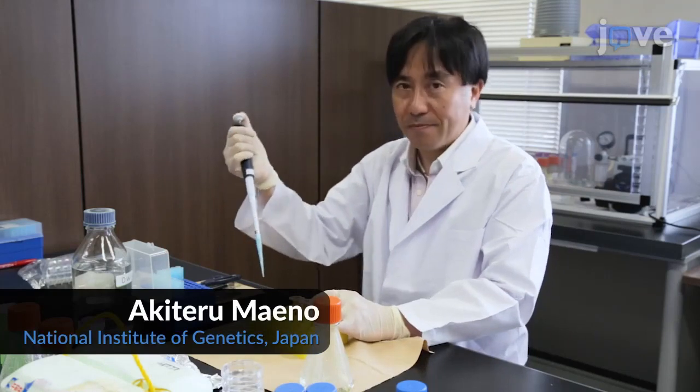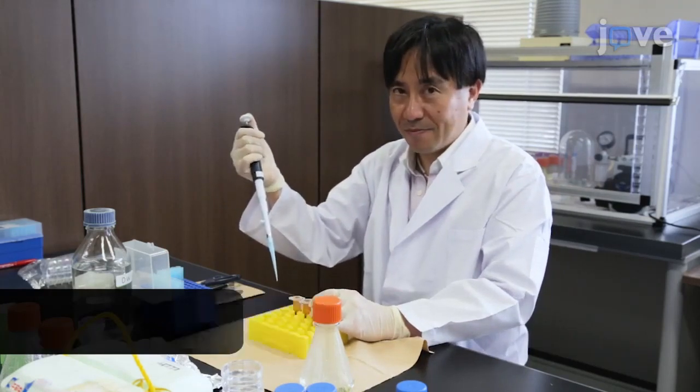Demonstrating the procedure will be Akiteru Maeno, a technician at the National Institute of Genetics, Japan.